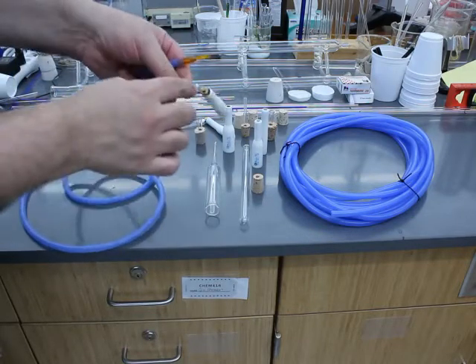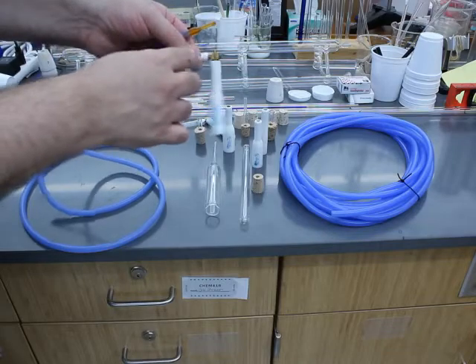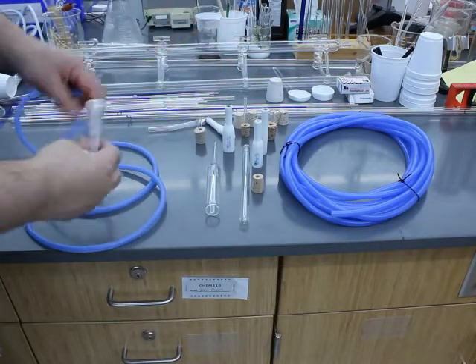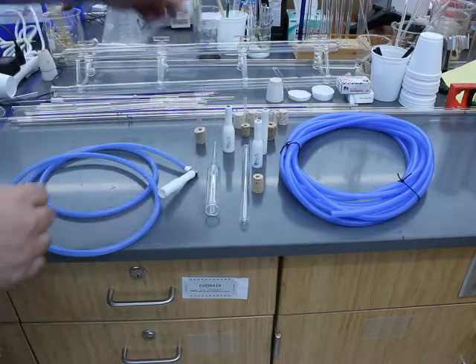In my case, I wired my swivel down with copper wire and then I put some Teflon on there to make it less dangerous as far as the wire stabbing me.